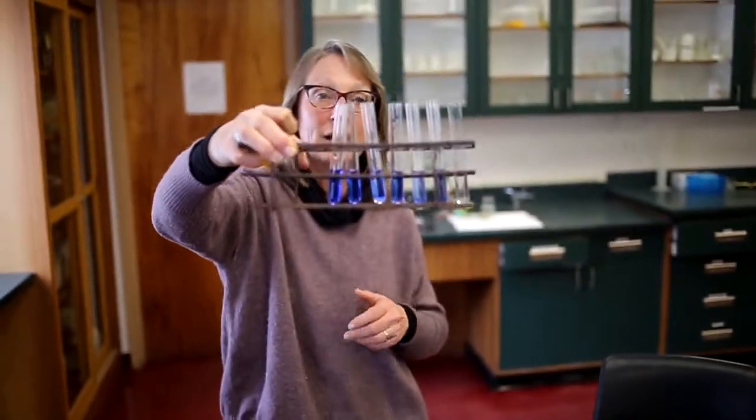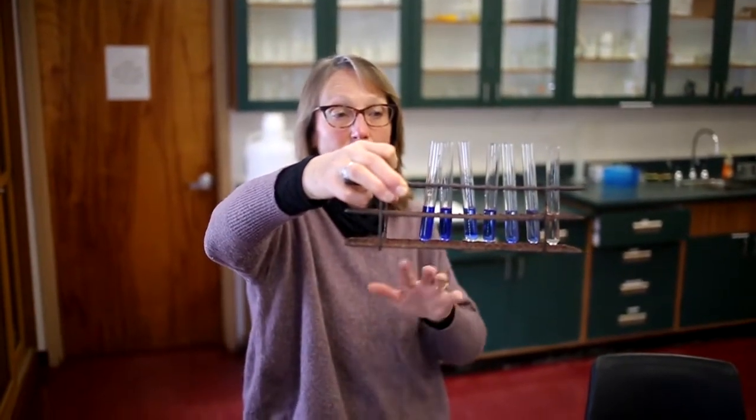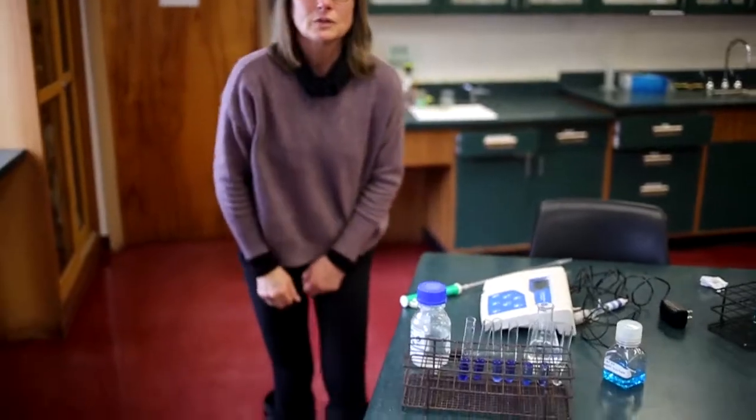So we would need to make another standard curve, and maybe we'd even want to adjust the wavelength to coincide more with the maximum absorbance of this more purplish blue color. So we hope that this exercise sort of demystifies when scientists and technologists make tests for things. Often they involve color, often it has to do with making visible that which is not visible, and using color is an important way to do that, and hopefully this simple chemistry experiment here and demonstration will shed some light on that for you.